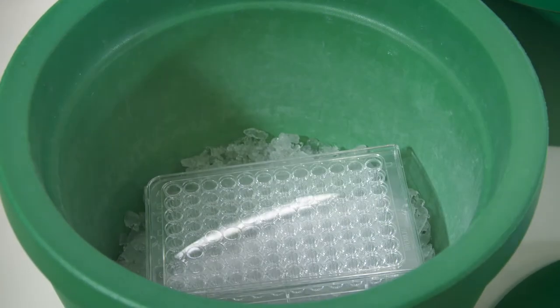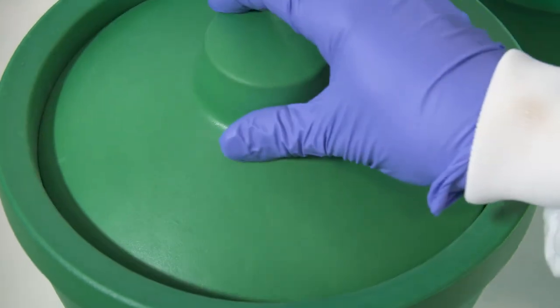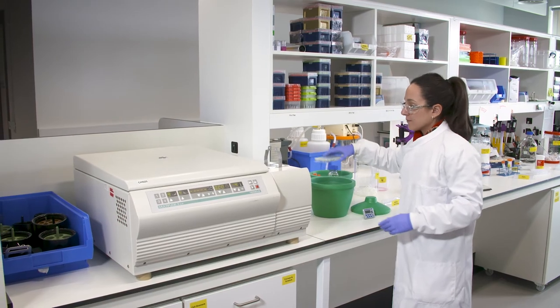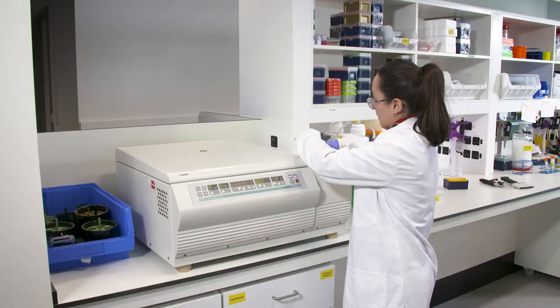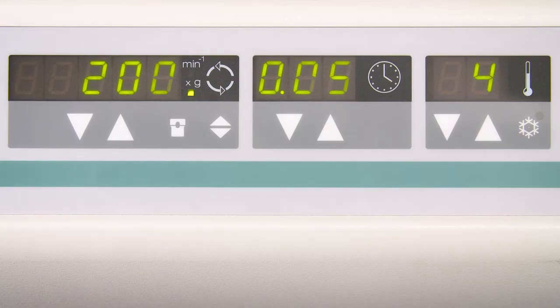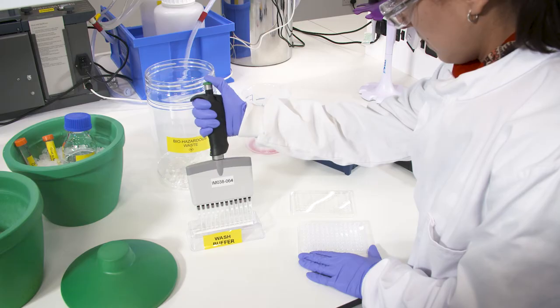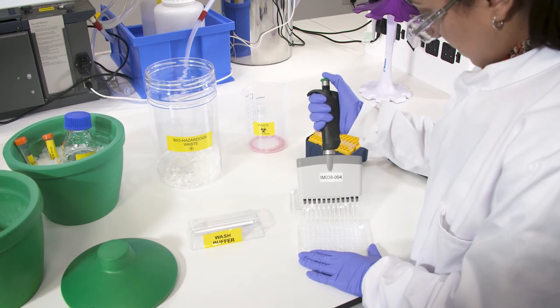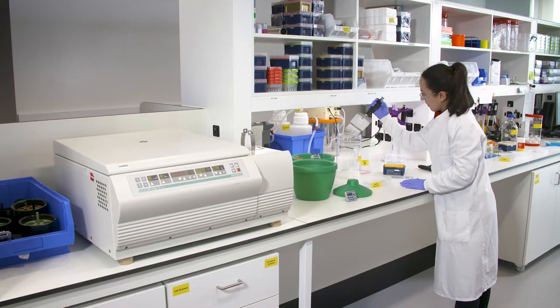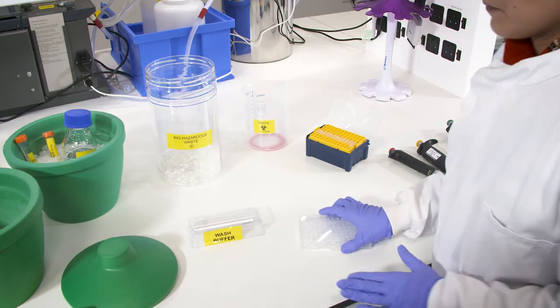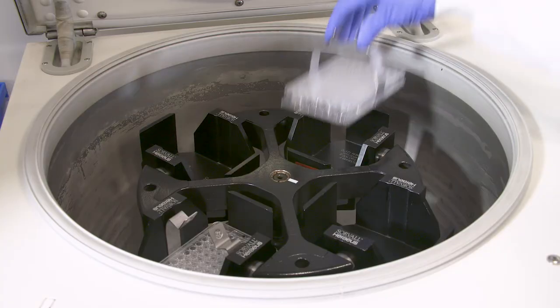Incubate for 30 minutes at 4 degrees Celsius. This incubation must be done in the dark. Wash the cells three times by centrifugation at 200 g's for 5 minutes and resuspend them in ice-cold wash buffer. These washes remove excess secondary antibody to reduce background fluorescence.